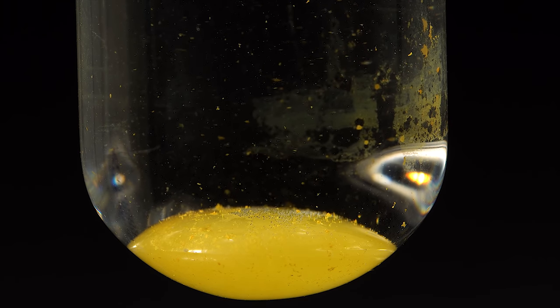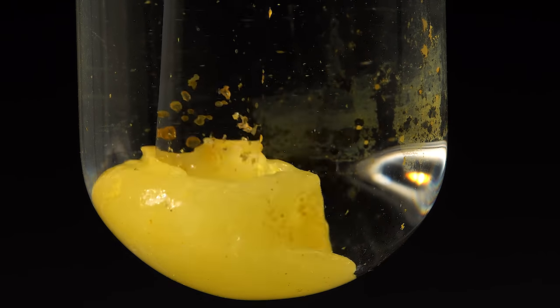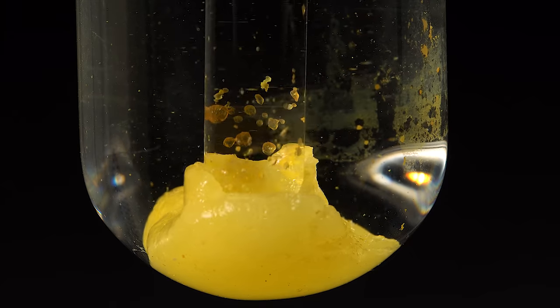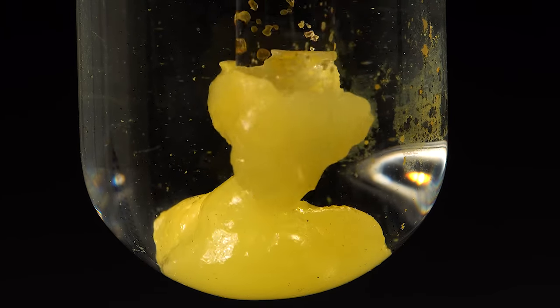White phosphorus tends to turn yellow in the light and, since I used powerful light sources to film this reaction, it came out to be yellow.